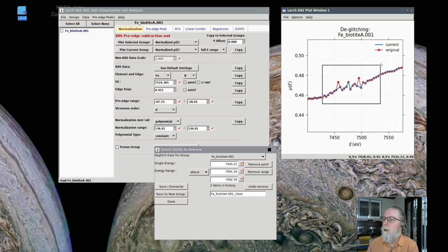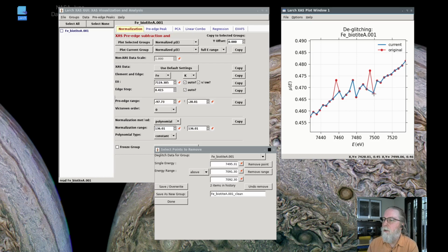And again, I'm clicking on the plot close to the point, and then clicking on the pin to select that point. You could type in an energy if you want. You might also look at this data set and say we should just remove all of the data in this range. It looks like there's a couple of glitches. This is not uncommon for them to come in groups of 2 or 3 and to have both a positive and a negative spike in them.